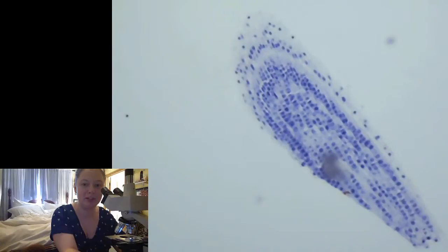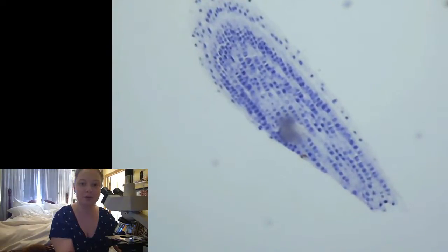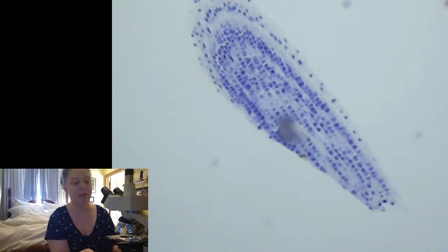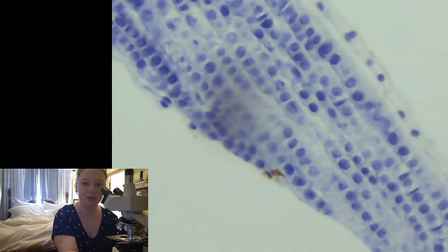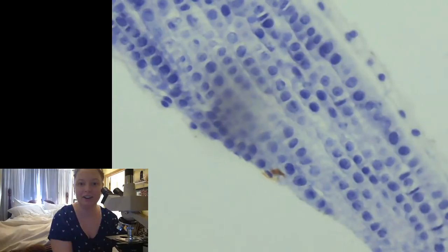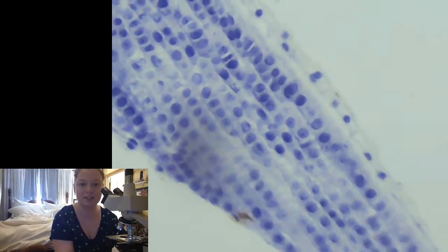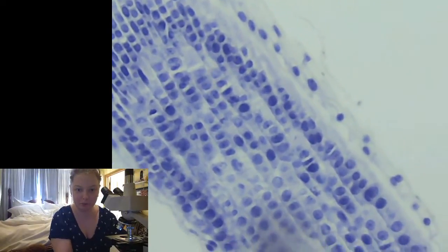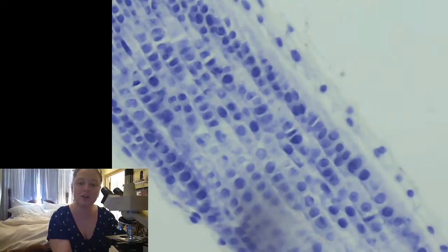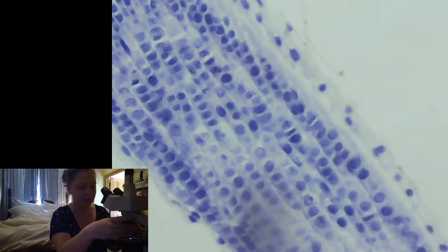hopefully you remember mitosis. So we can move it over a little bit too, so you can get a better view. And then if we want to go a little deeper, we'll move it over to our next slide, and that's going to make it fuzzy again. So we have to bring it back into view. We can see, these cells are going to all be in different stages of mitosis. So this is an onion root tip cell, and the tip of an onion root is growing. So all of the different cells are going to be going through mitosis.